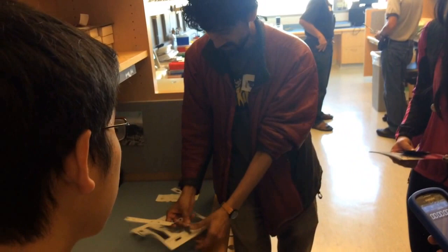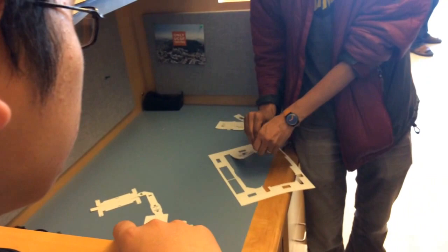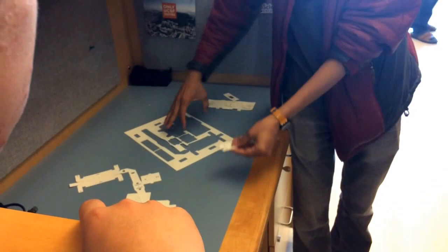Okay, this is piece number two. First, you notice that this is kind of waterproof paper. It's different from normal paper. Right? Because you want to make instruments that will survive all kinds of things. This is the same material that's used to print currency. So it's called tear-proof. So the first fold is right there.